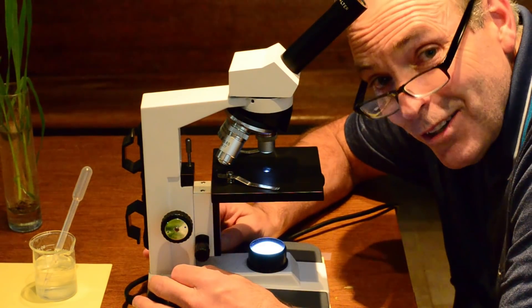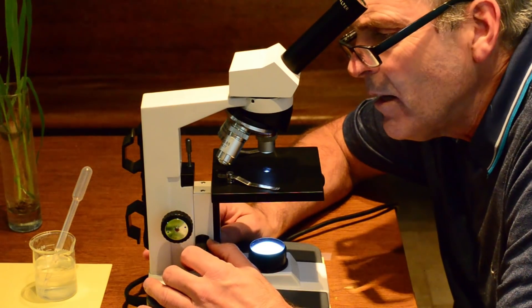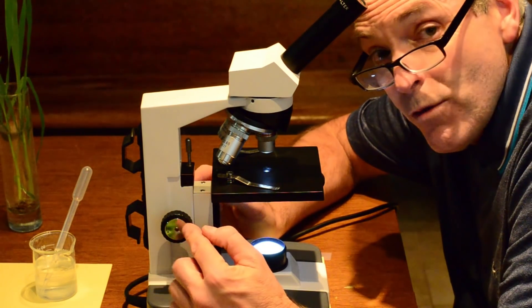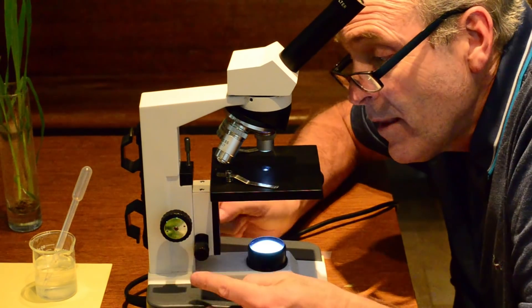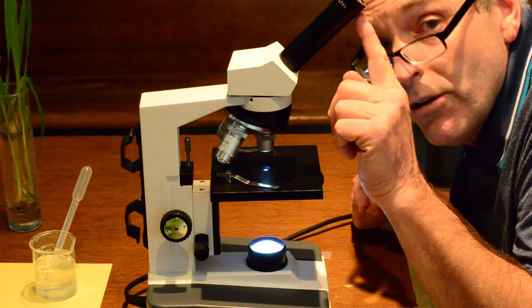You know, I love microscopes. They're a lot of fun to analyze living things. And so what I want to do is review really quickly. Remember, this is your coarse adjustment knob, your fine adjustment knob. These are your objective lenses and your eyepiece.